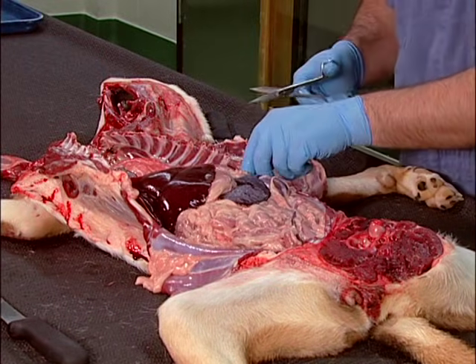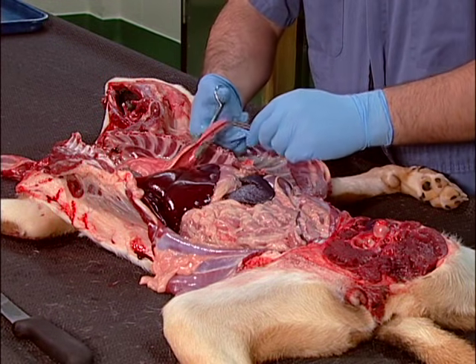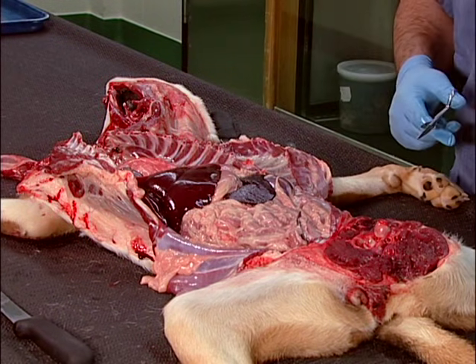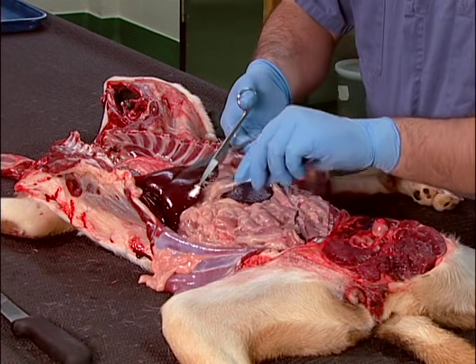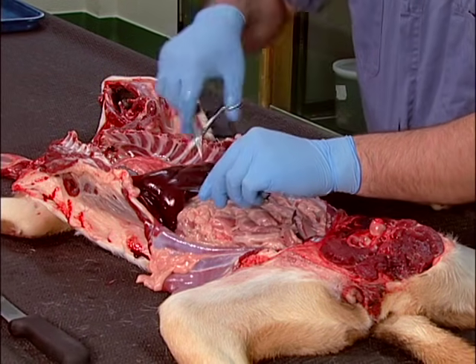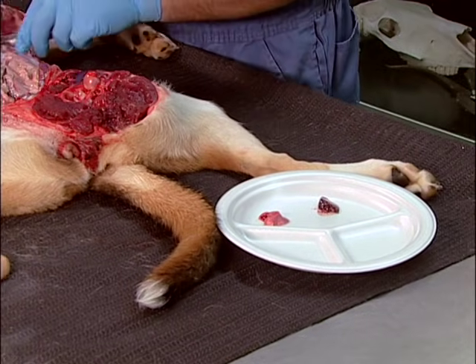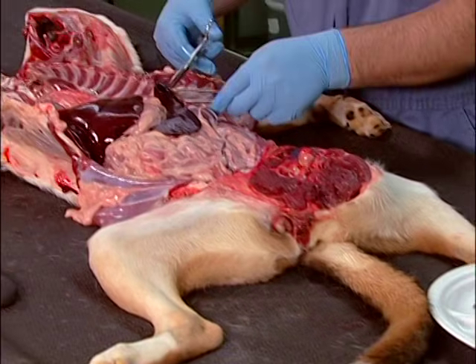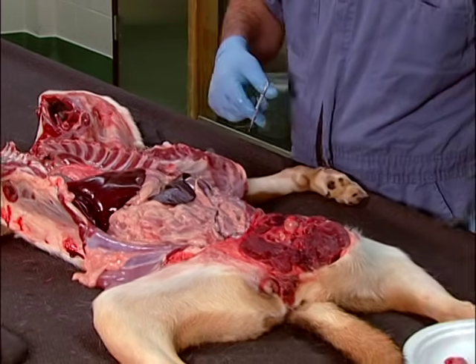Examine carefully the position and the potential misplacement of organs, because once they are manipulated or removed, this crucial information may be lost. Examine the volume and the surface of the lungs. Open the pericardium and examine the amount and quality of pericardial, pleural, and peritoneal fluids.